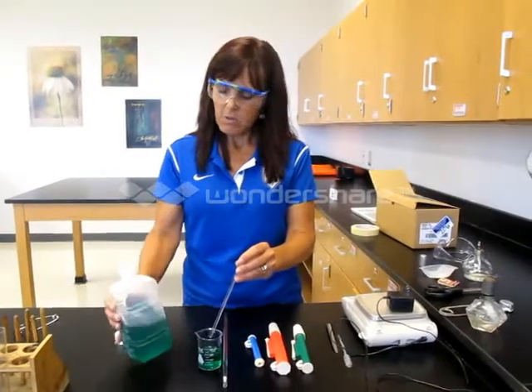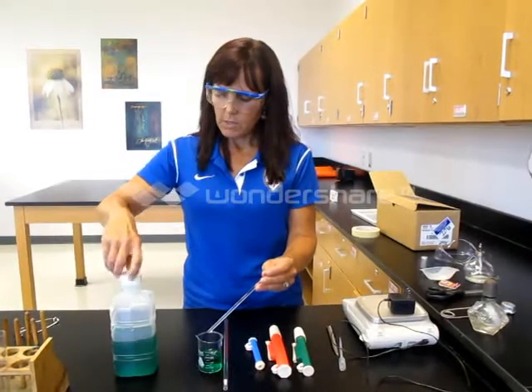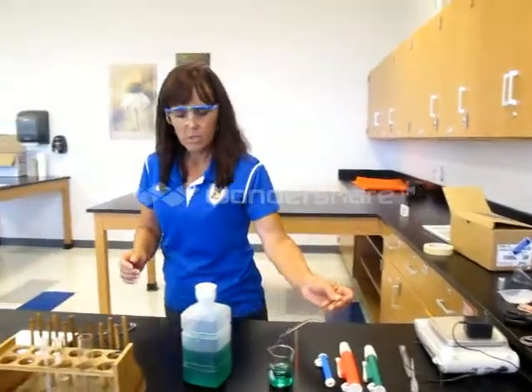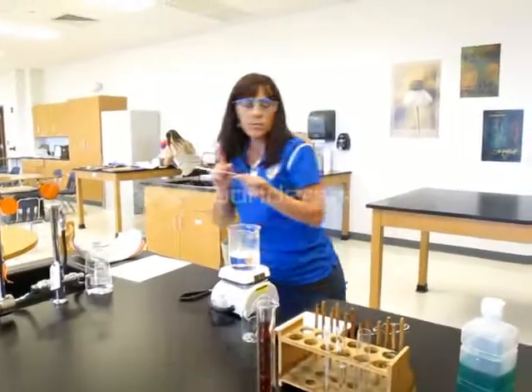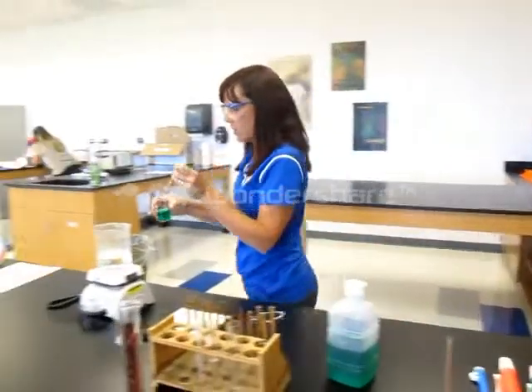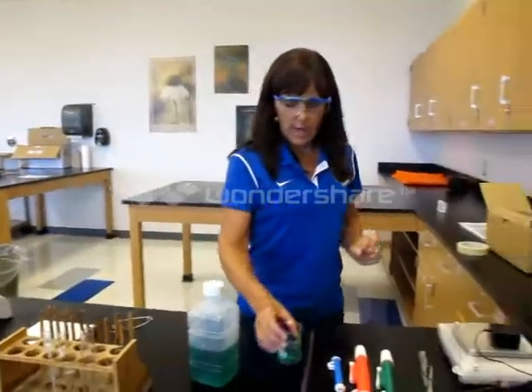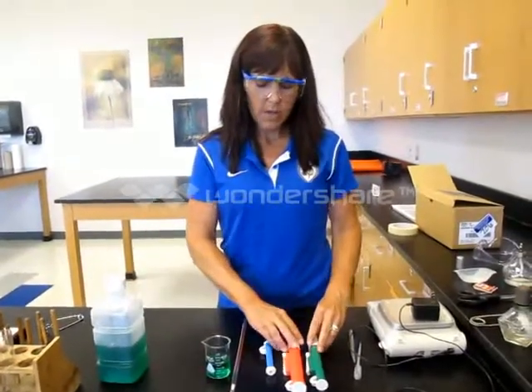Now I have a second working solution here. I'm going to put my glass stirring rod in the sink in case this is something we do not want on the table. Really what I should have done is taken everything over so I don't drip, and set it down properly.